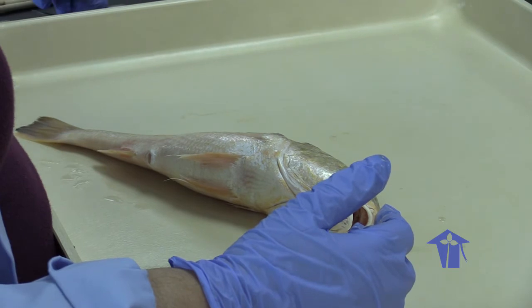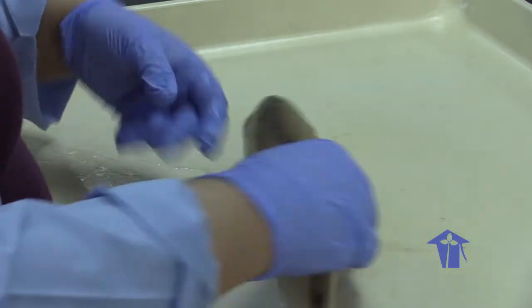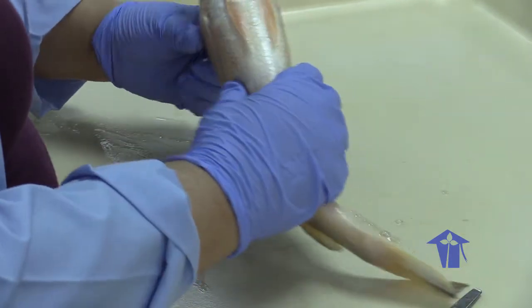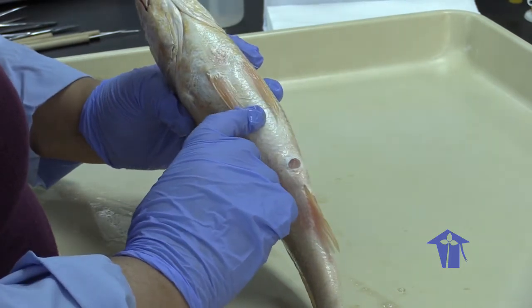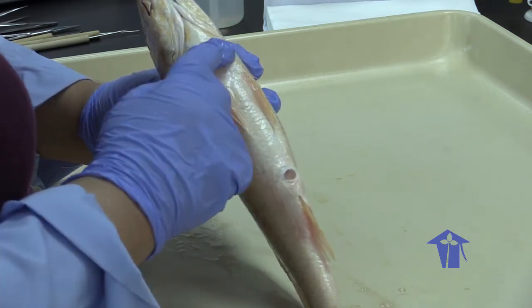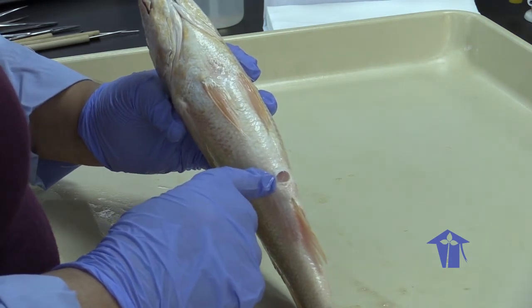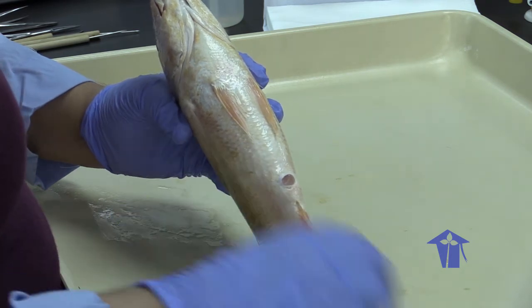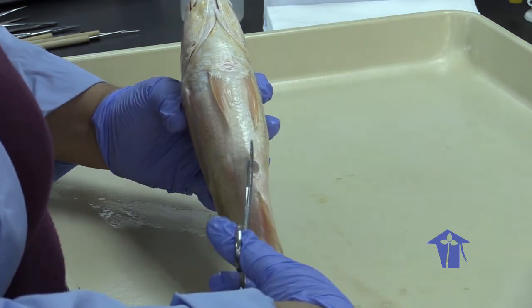So what we're going to do again, we're going to make a ventral incision in our fish. So again, if this were an invertebrate, we'd make a dorsal incision, but because it's a vertebrate, we have our backbone that's going to block anything. We're going to make a mid-ventral incision cutting down the midline of the belly of this fish. So this again is the cloaca. The cloaca is a shared opening between the urinogenital and the digestive openings, right? So we're going to cut here.